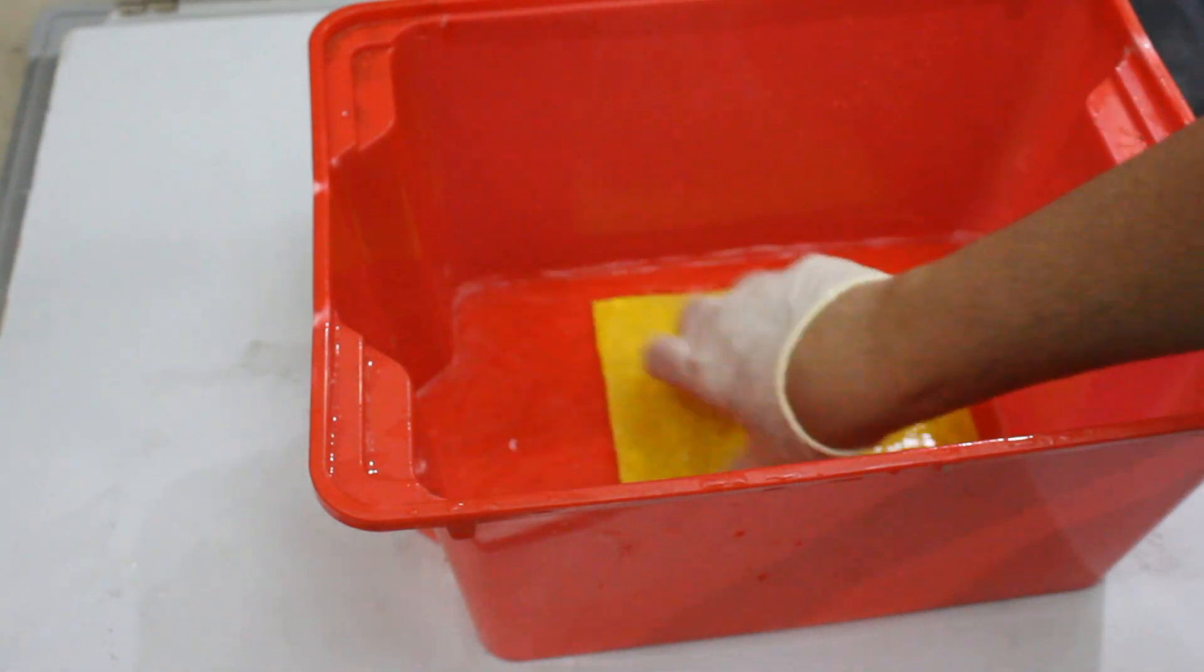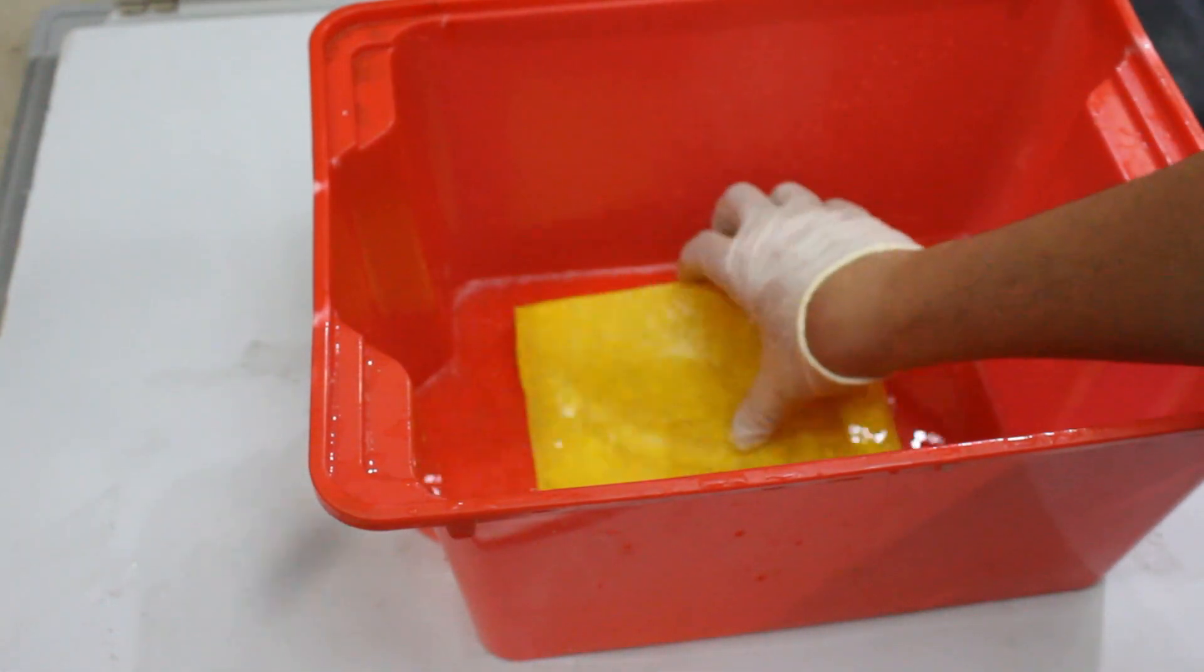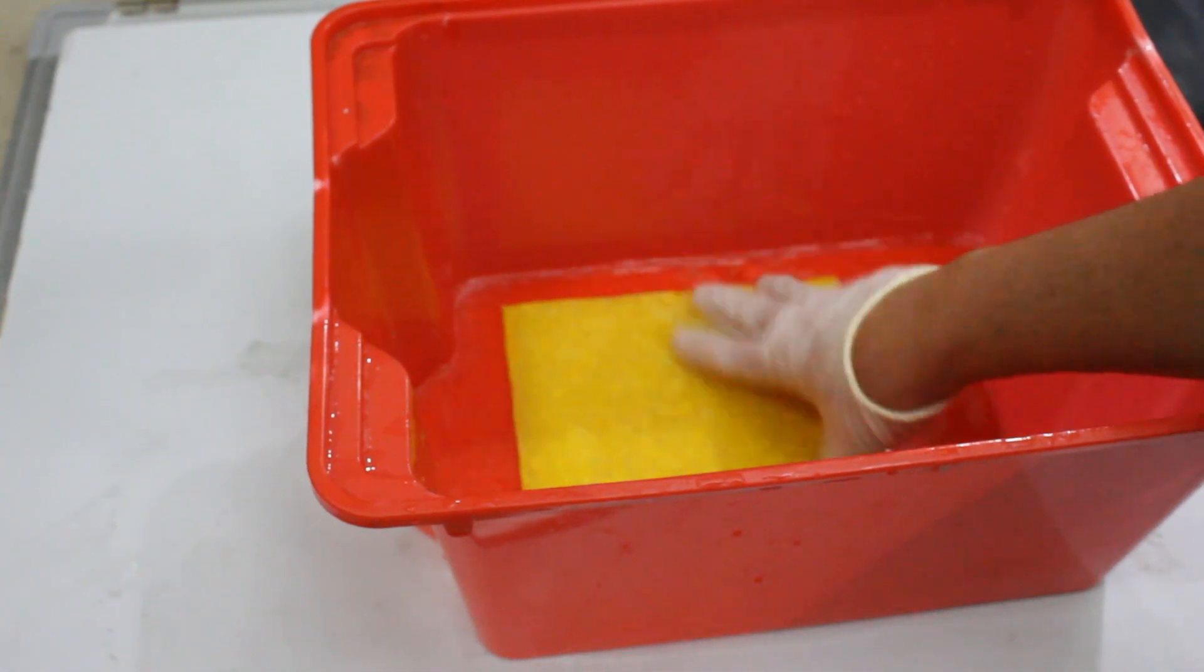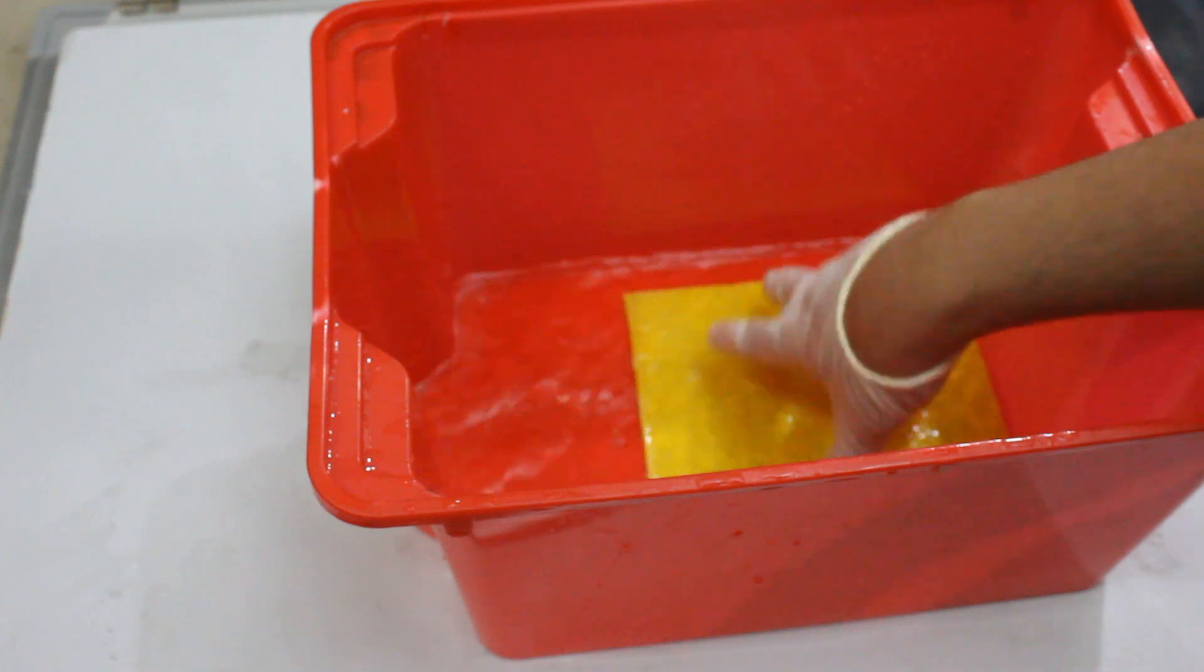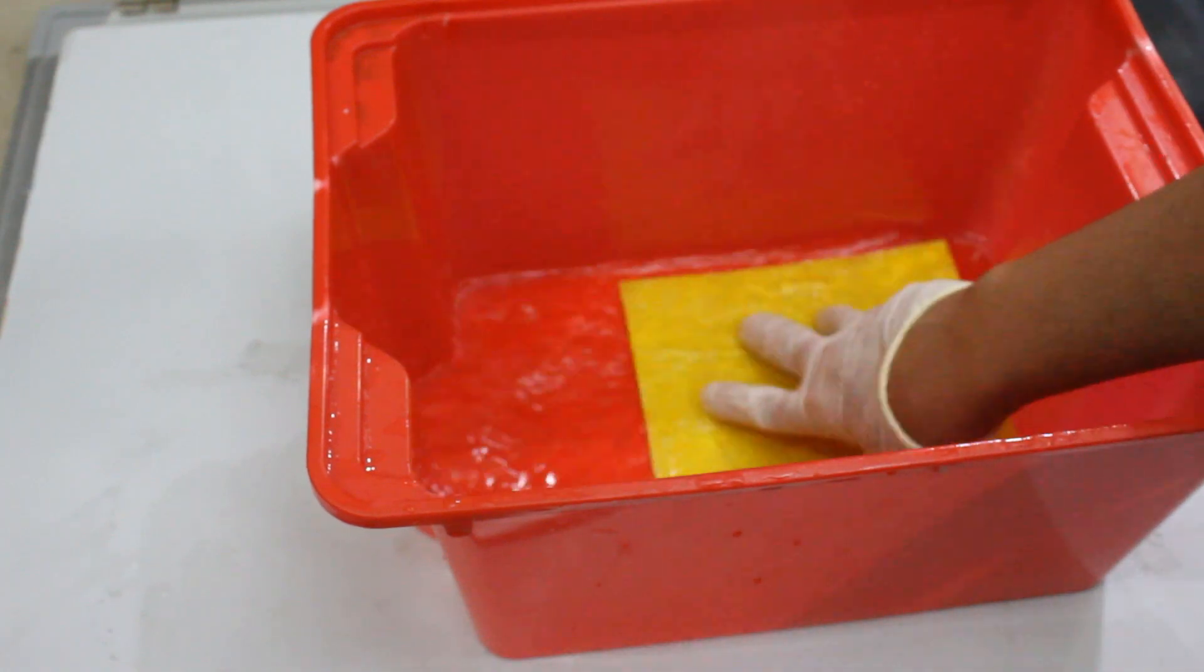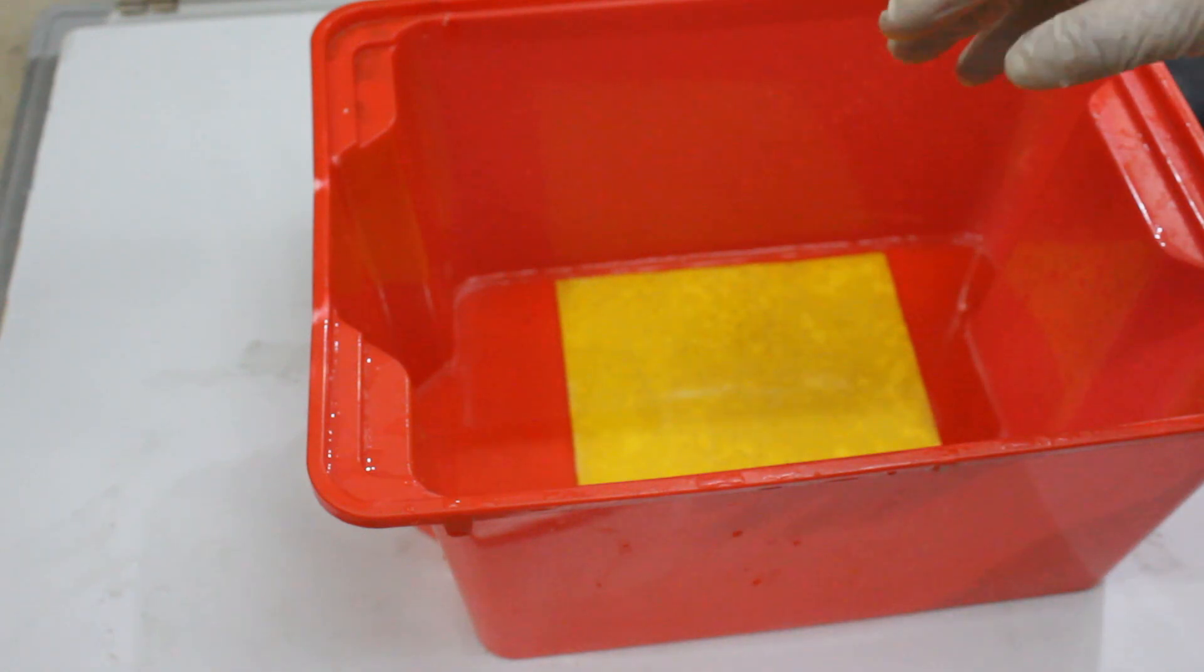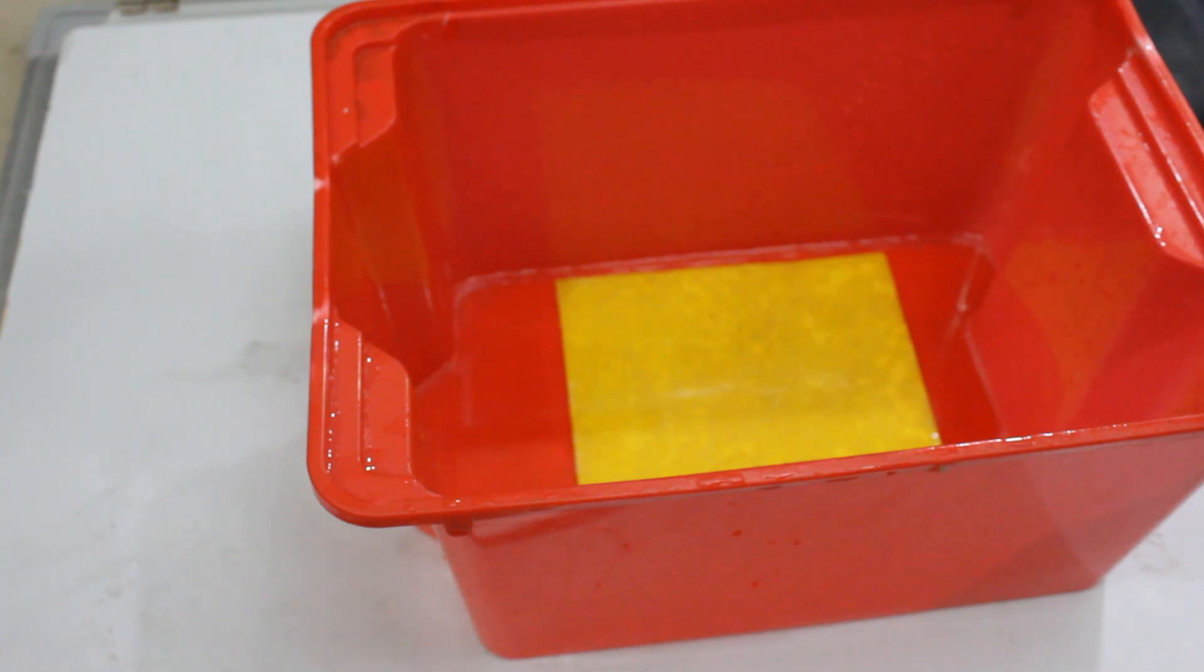Once I put it in here, like after a few hours, it's gonna get really hard because the citrate's gonna start to link with it. It's actually getting harder now. It's not as bendable as it was before, and it will also change color slightly to a slight whitish color. But you just want to leave it in here for like maybe six hours or something for it to fully react, and eventually you'll end up with a nice membrane that you can dry out.